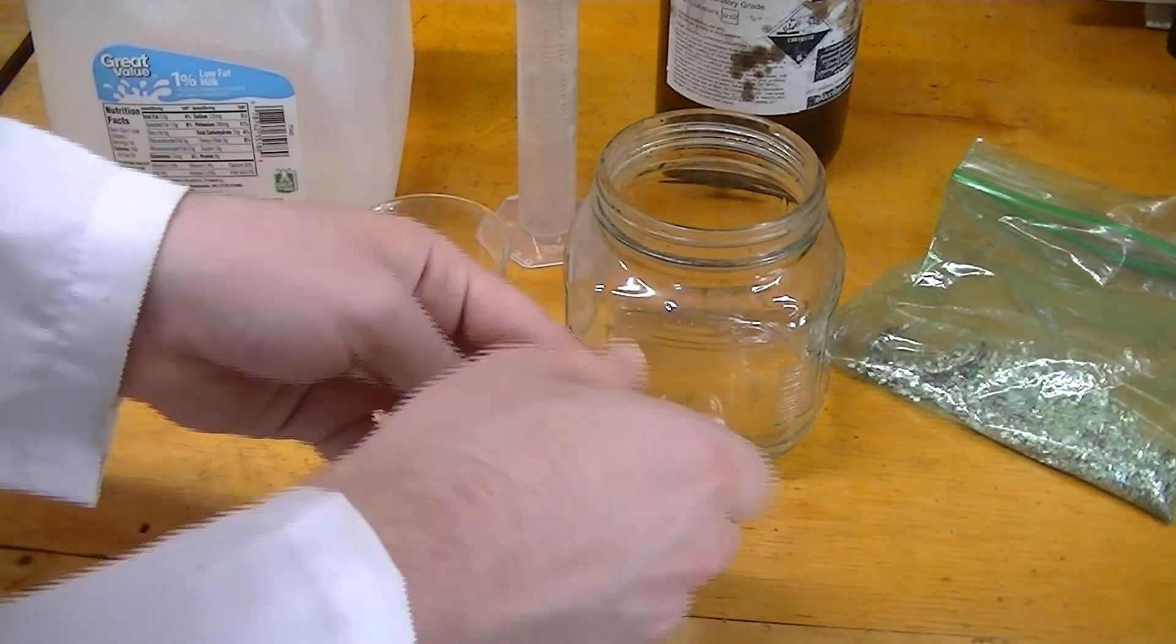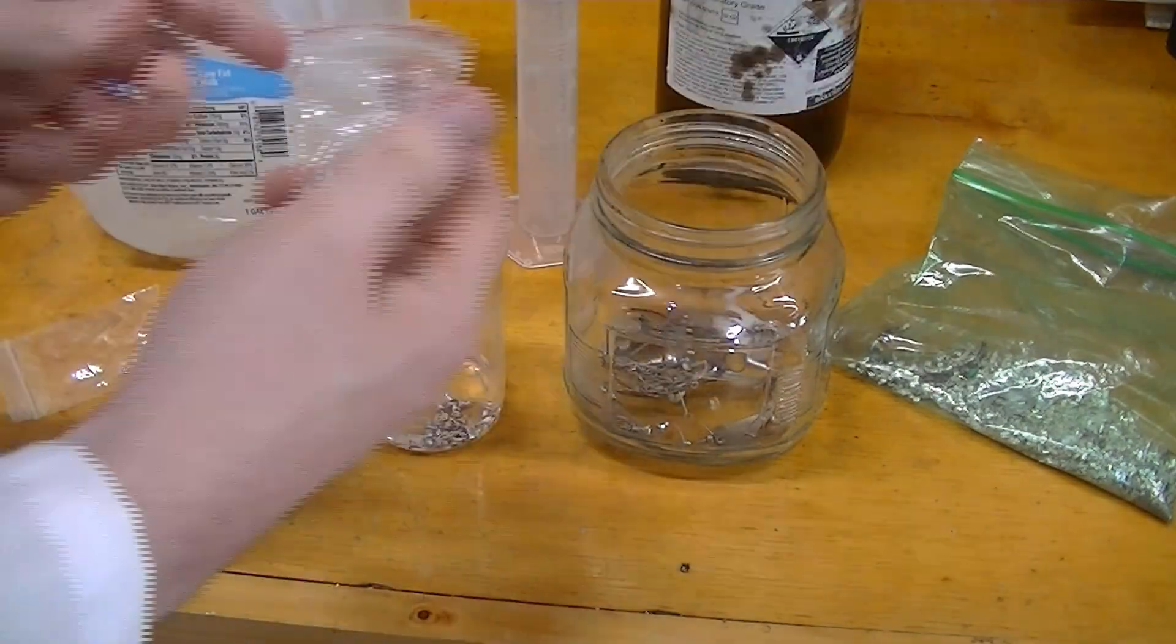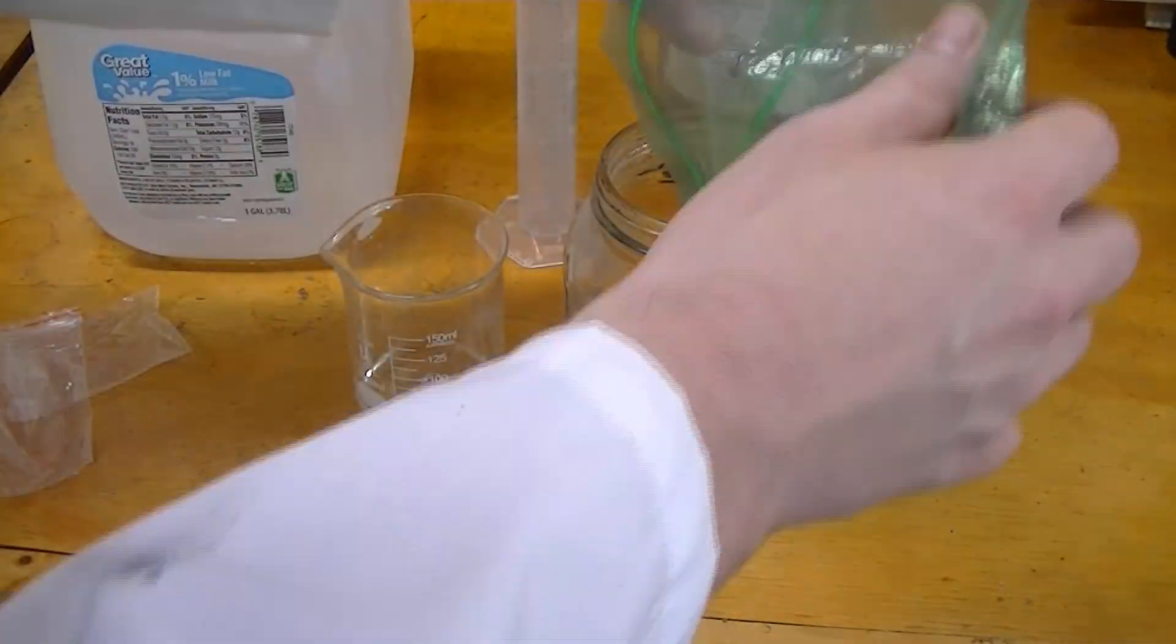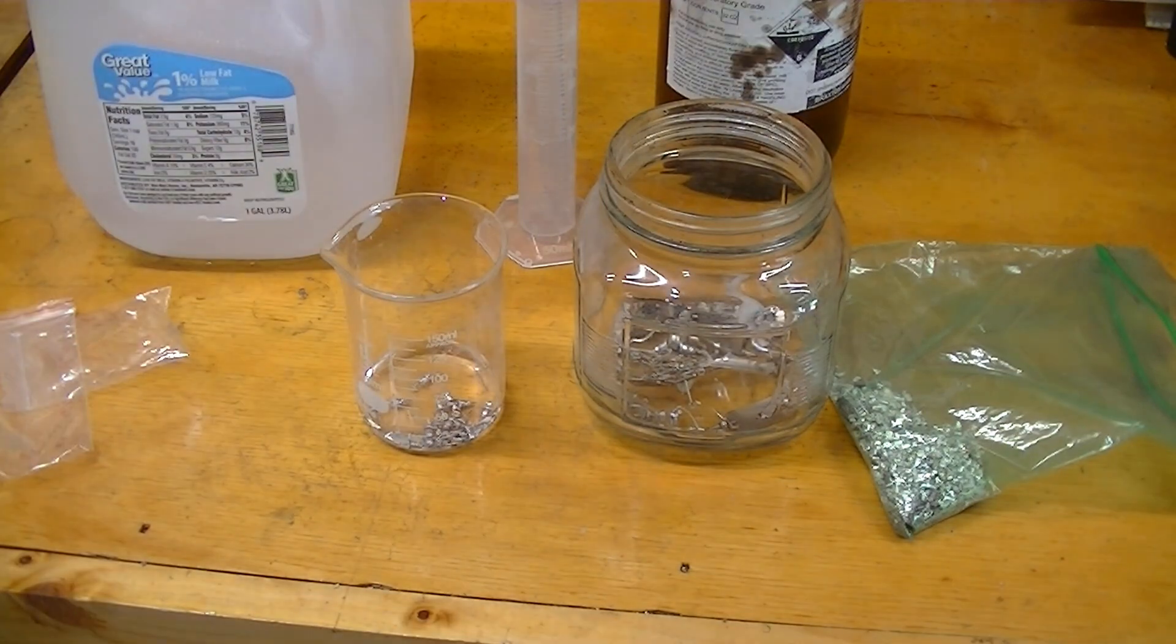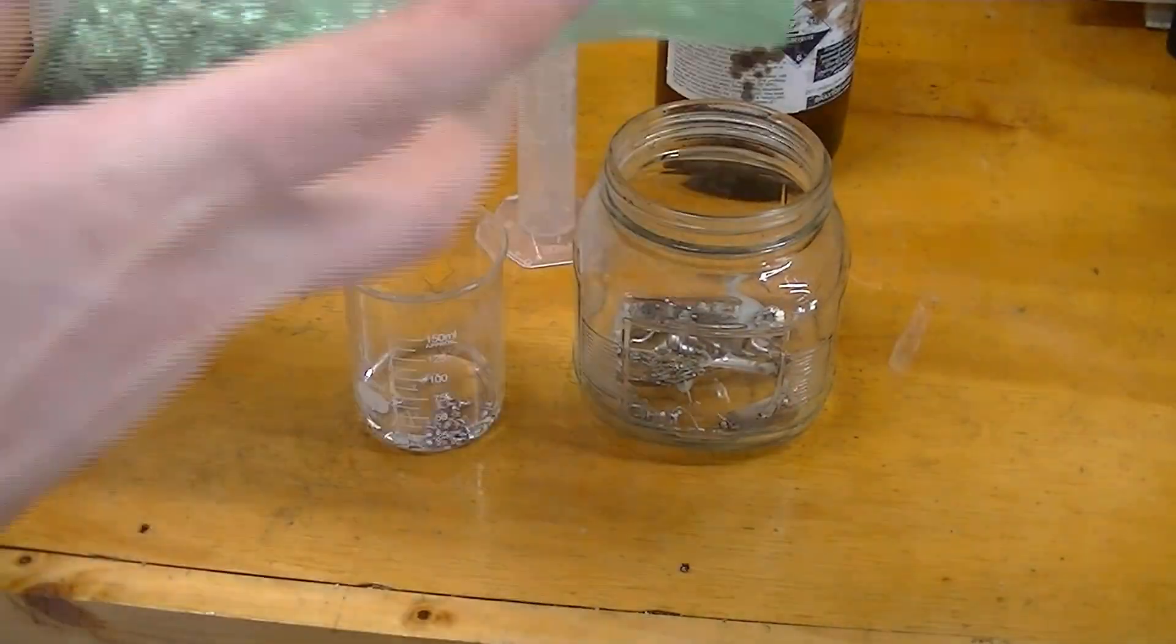Now, the water I'm using right here is clean distilled water, because any contaminants in our water will transfer over to our silver, and we want the purest silver that we can get.